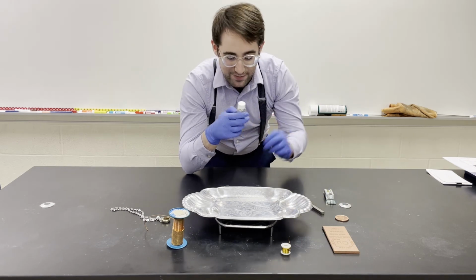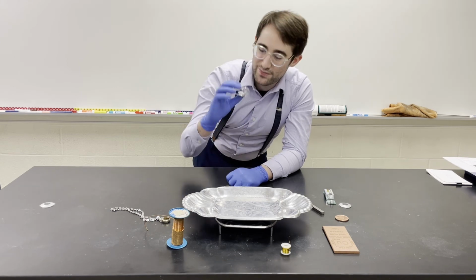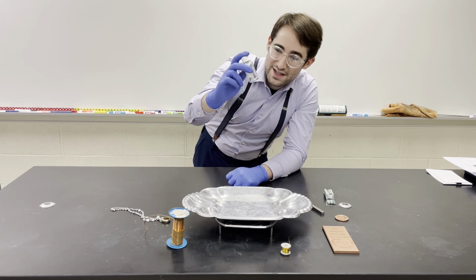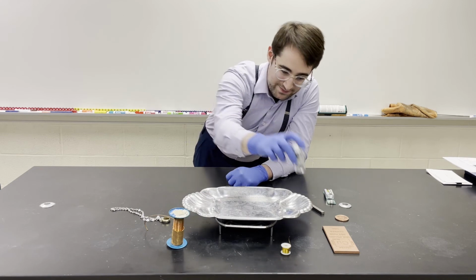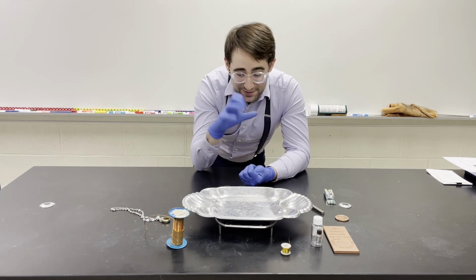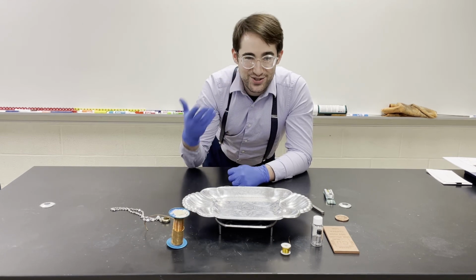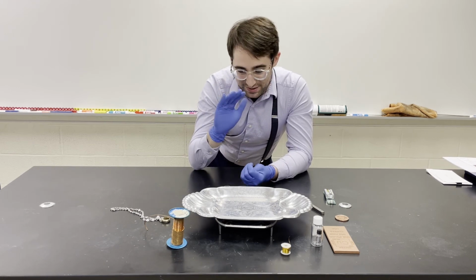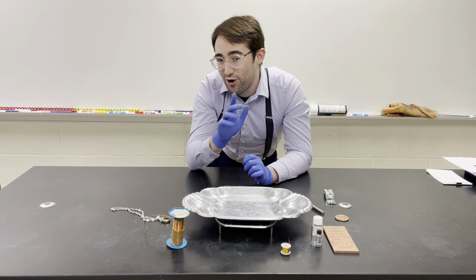Some samples in the lab might be kind of hard to test by hand for safety reasons. So like in this case, barium is held in 2 vials, and on the inner vial, it's under mineral oil to keep it away from the oxygen and the water in the air. There are other samples that are in jars that have lids on them for a reason. Whether it's because the powder can be dangerous to inhale, or it's bad on your fingers, or something like that, they're contained for a reason. So don't take things out of the jars unless the jar is already open.